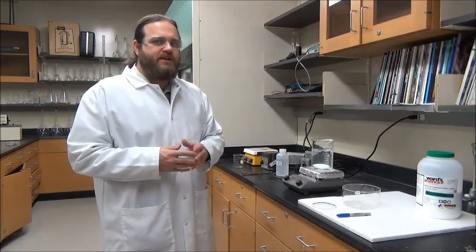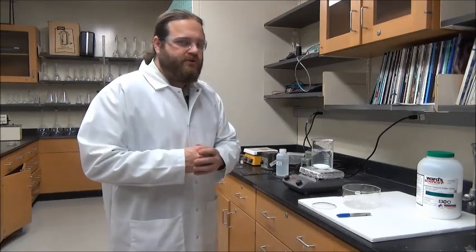We're now going to want to transfer our crystal growth solution to our crystallization container. We could certainly just let this cool in this container and try and get the crystals to grow that way. But when you're wanting to grow seed crystals, it's nice to have a nice flat wide dish because you want to grow nice single isolated crystals. If you have a very tall skinny container, you may get nucleation of crystals, but if they grow together they're not really going to be suitable for use in growing nice large single crystals. That's the name of the game with these competitions - large single crystals.